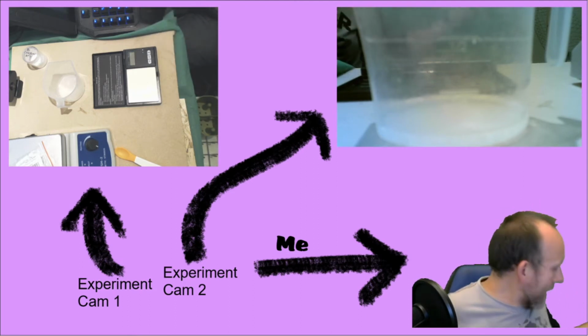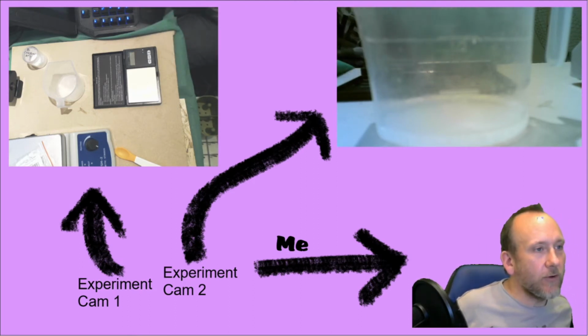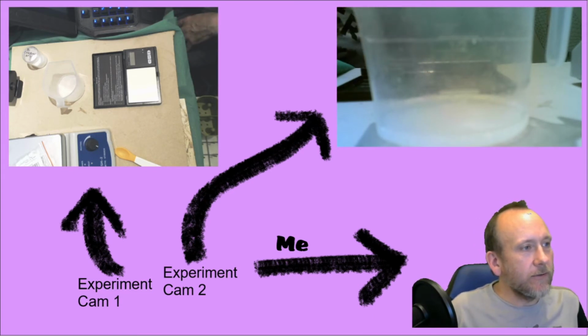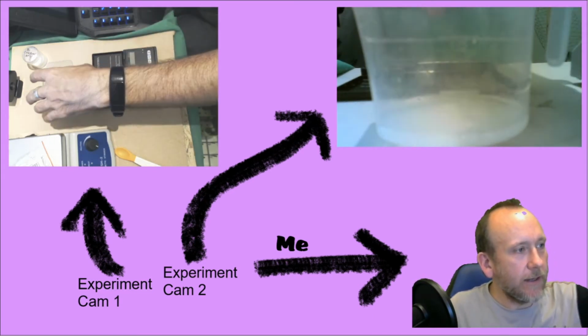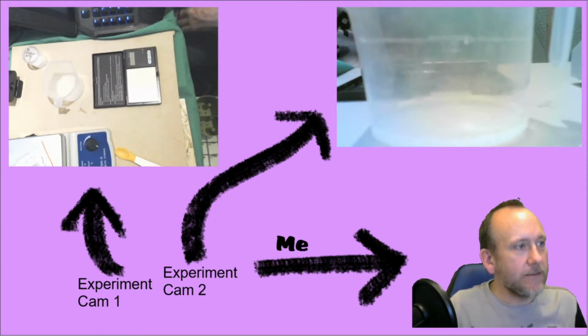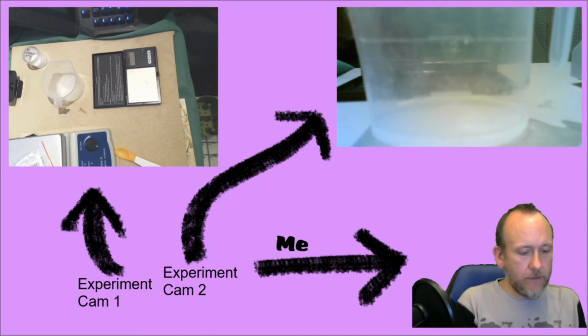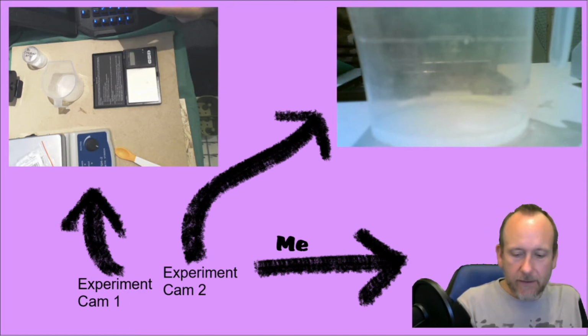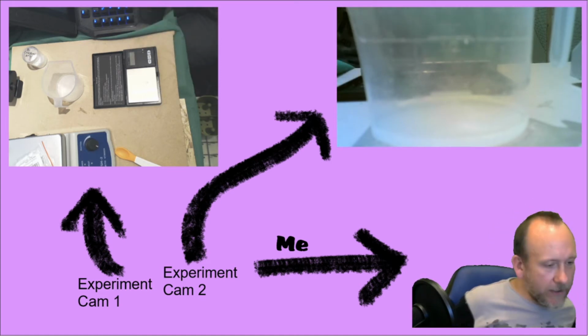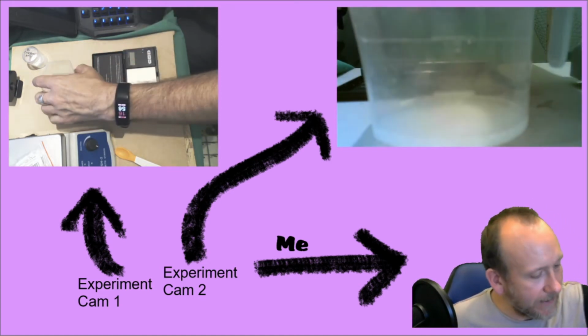So I've actually added 7.92 grams of the vinegar. So the vessel and the sodium hydrogen carbonate and the sample liquid should have been 35.39 grams. Now I've got to determine what the mass is at the end of that.